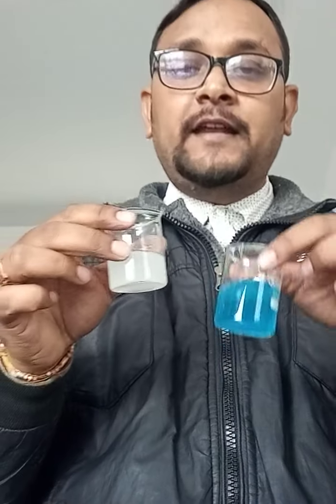So I'll keep it nicely. Okay, so what will happen to the salt containing sulphate radical if you add barium chloride into it? This is an identification test to confirm or identify the sulphate radical. Now let's see what happened first. Once again I would like to show you.